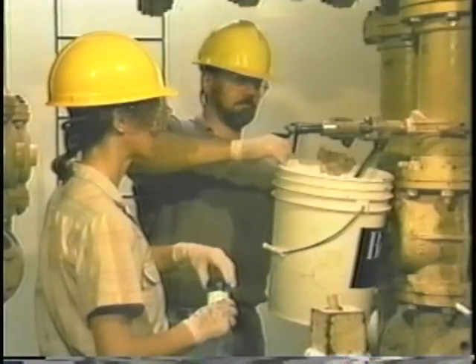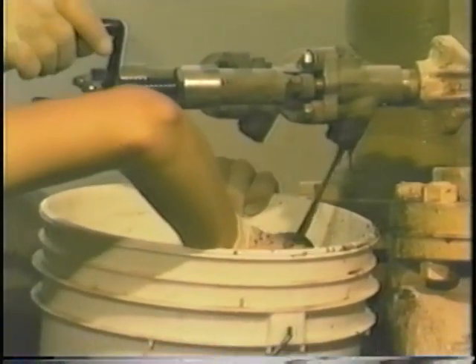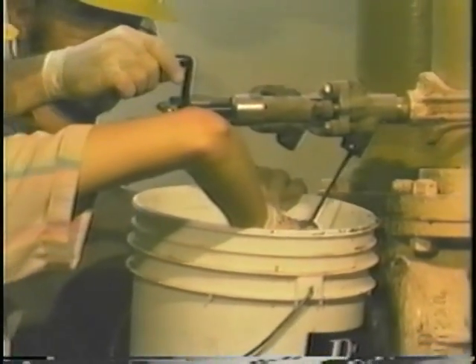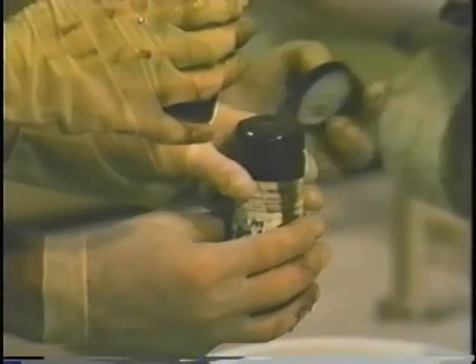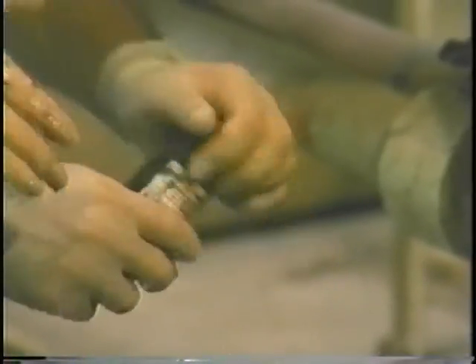For volatile organics, you want to prevent the pollutants from volatilizing in the container. In this case, fill the container to overflowing. Put the cap on and flip the bottle to make sure there are no air bubbles.